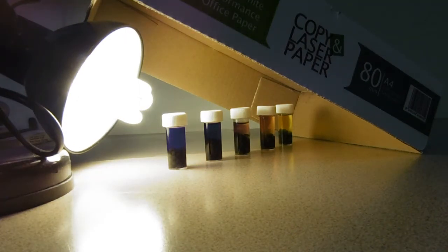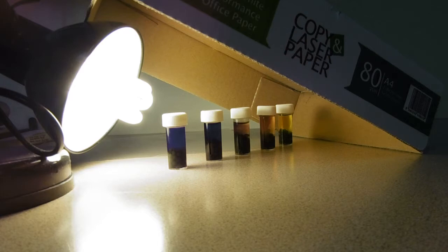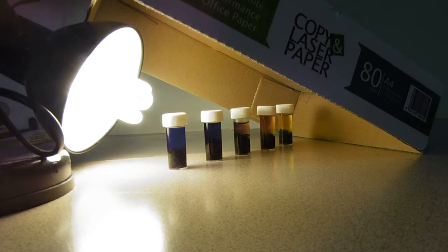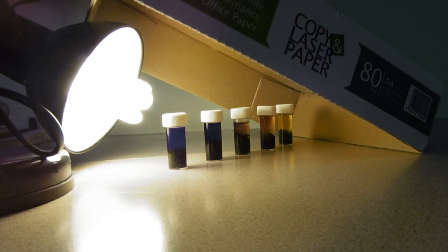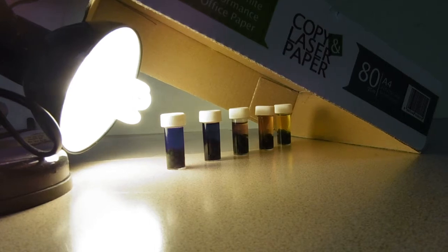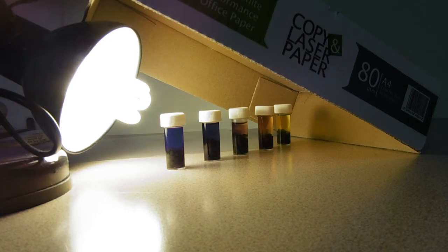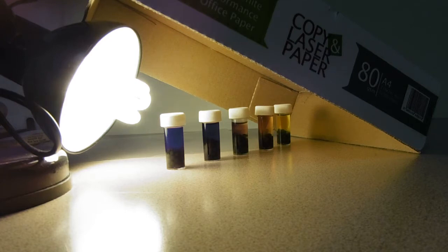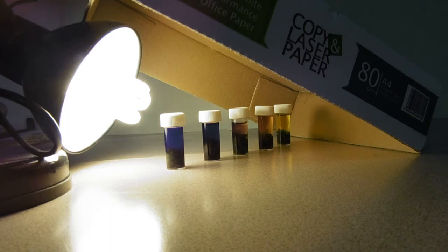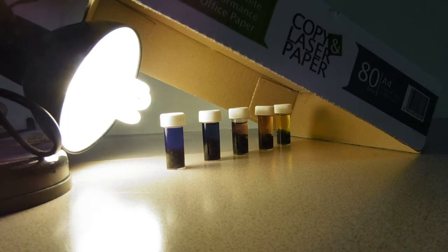This is a setup for one independent variable. What we're assessing here is the impact of light intensity on what color that indicator changes to. That will give us an idea of how much carbon dioxide is used or how much carbon dioxide has been produced.